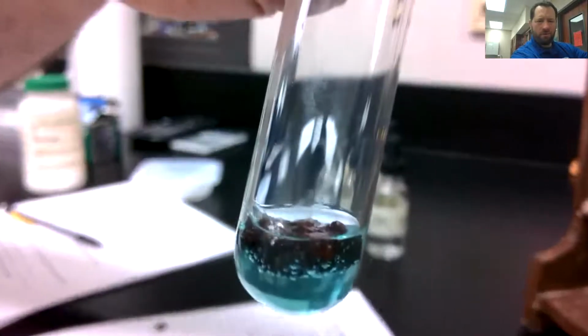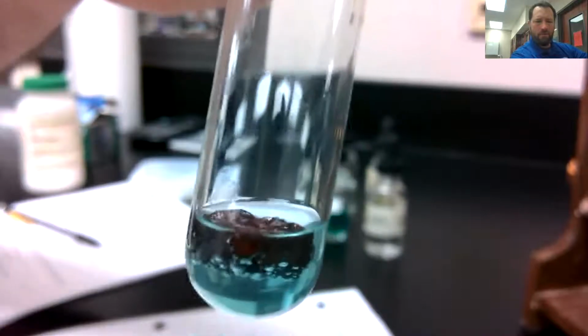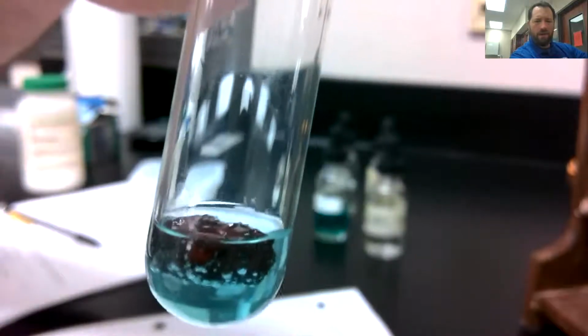so you guys can see that color of the aluminum. Look at that color. I know it's a little blurry there, but there we go. Look at that color. And when we started off, we had that nice piece of aluminum foil. You guys all remember what color aluminum foil is? We'll take a look at it now. Man, why did it change that color?